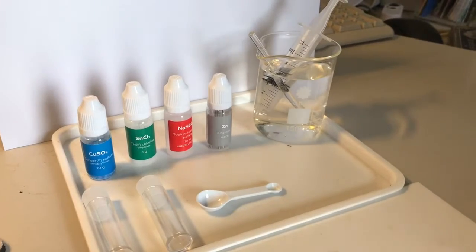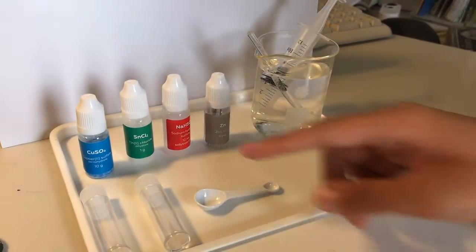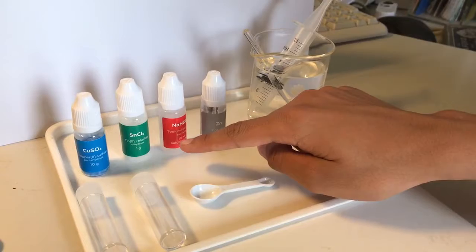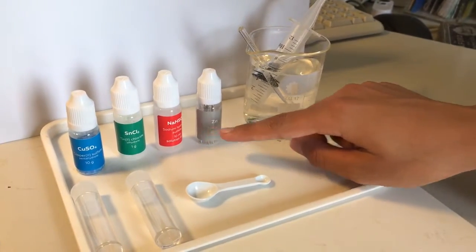In this experiment the chemicals we will need are copper sulfate, tin chloride, sodium bisulfate, and zinc.